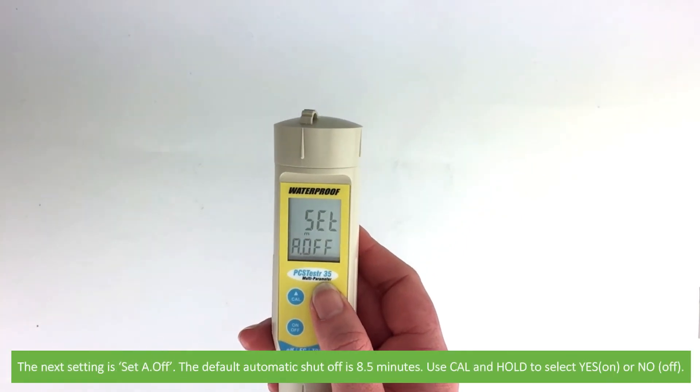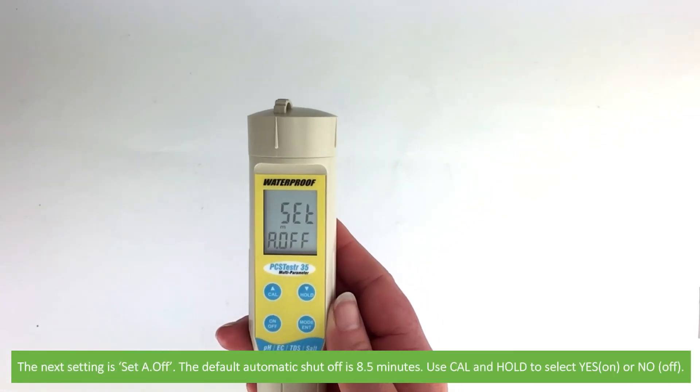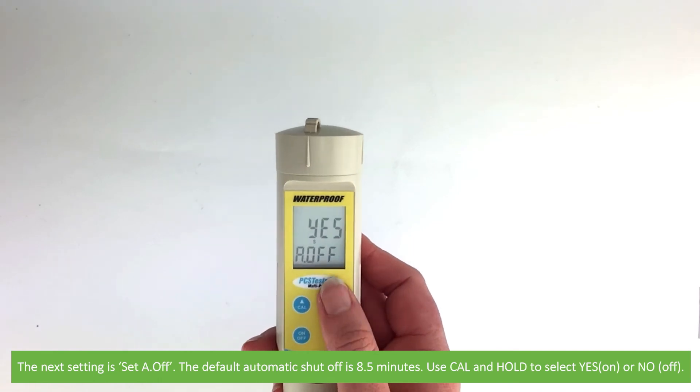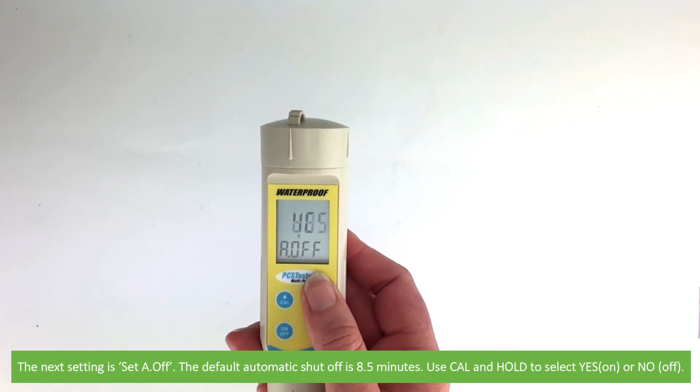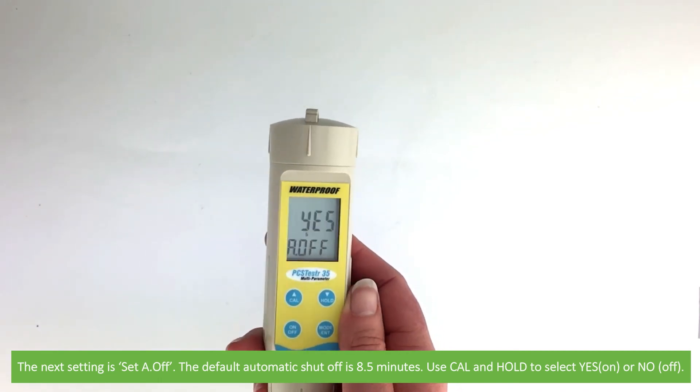The next setting is set A off, the automatic shutoff. The default automatic shutoff time is eight and a half minutes. Use cal and hold to select yes for on or no for off.